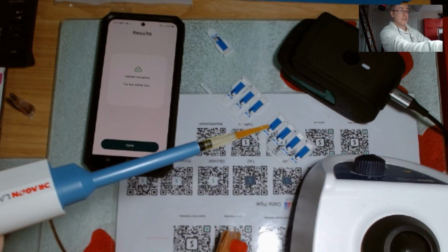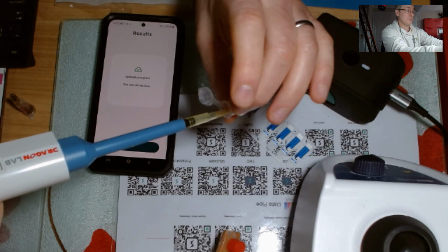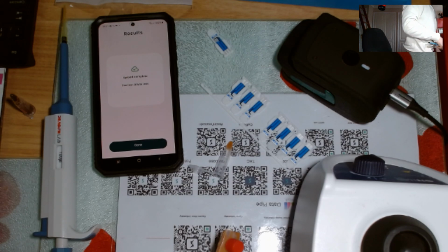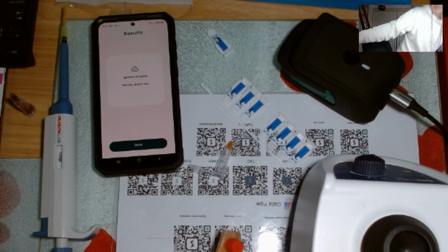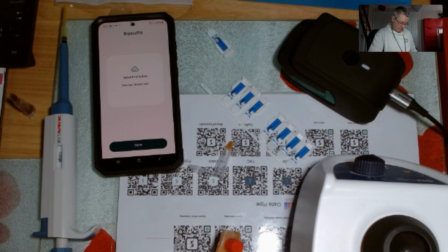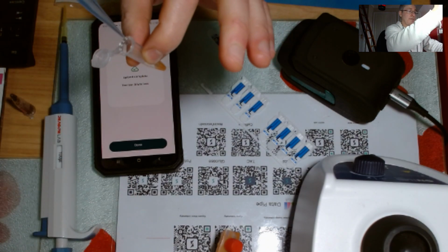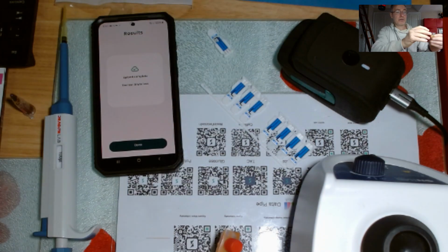Right, so I've got my 100 microliters here. I will put it into this vortex tube. Right, which I've now done. Excuse me while I grab 900 microliters. I just need to grab a pipette tip, so give me 1 second. Right, I've got the pipette tip. And I'm just going to put in 900 microliters into this sample, which I've now done. It's probably important to work on this scale because otherwise you're just wasting material. So you can see the suspension now. I've got my vortexer in front of me.